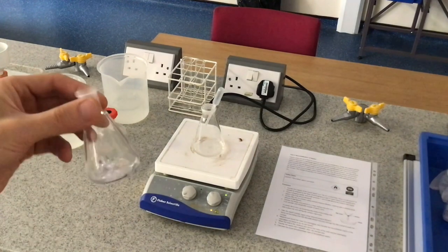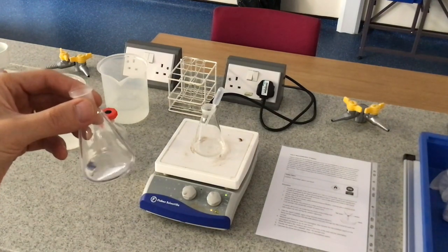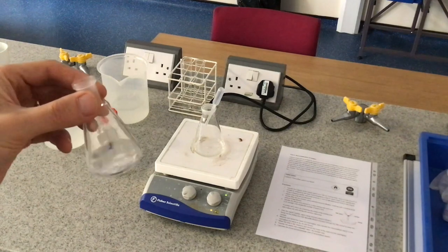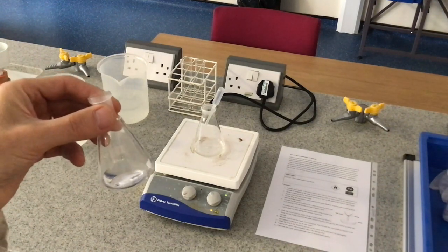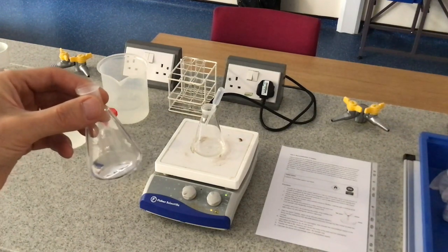The aspirin is all dissolved now, so I'm going to put it back on the hot plate and keep this nice and hot while I explain the next stage, which is the filtration.